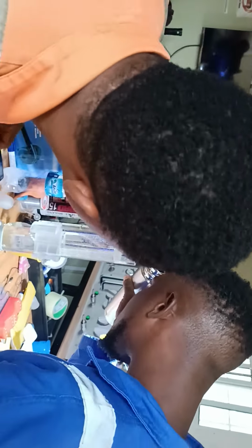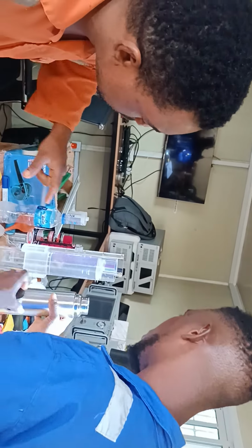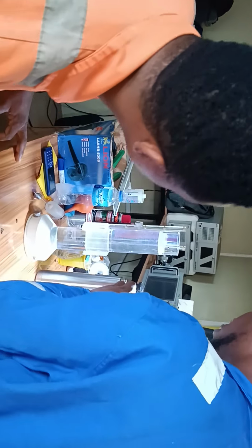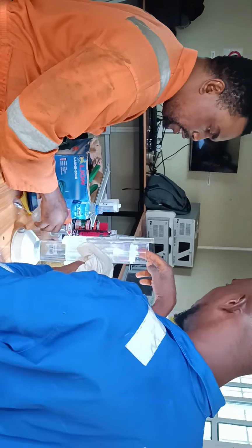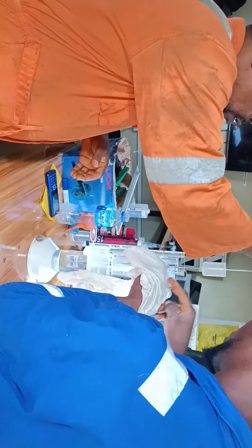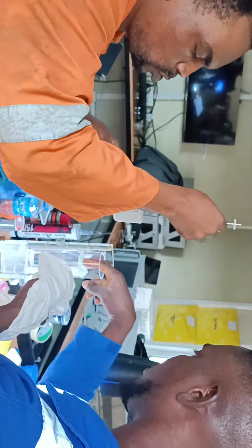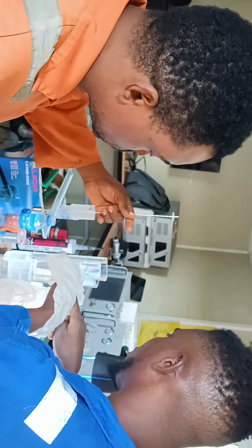When you get to 4 cm, please monitor the foam and make sure that the foam is not disturbing the region. We just have to clear the foam.